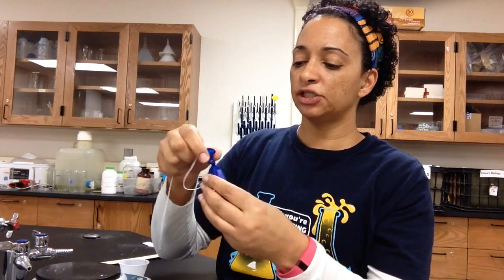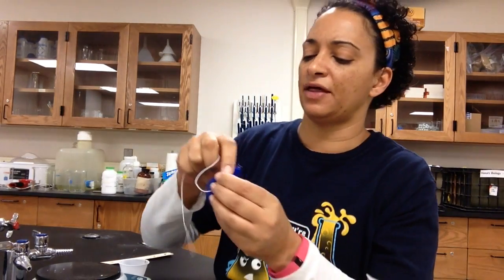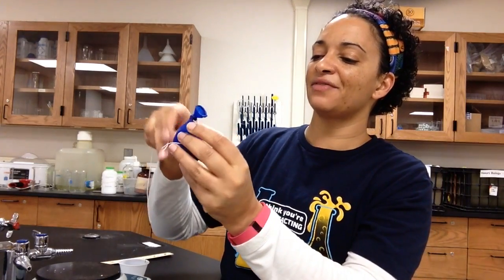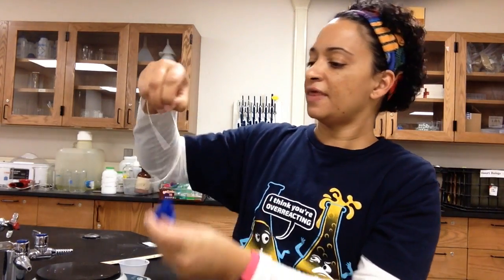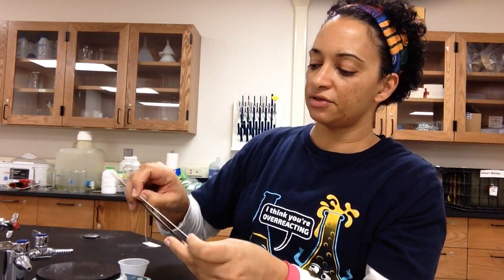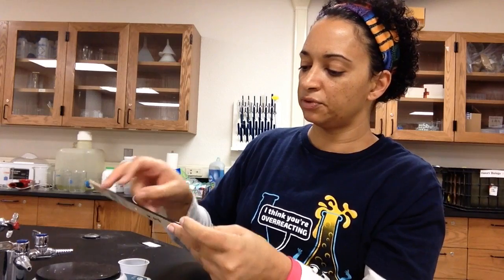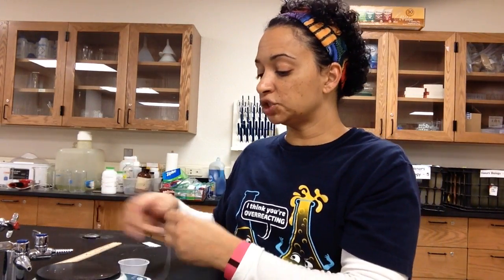Then I need to measure the circumference of the balloon. I'm going to take my string and measure around the circumference of the balloon, then use my ruler to figure out what that circumference is in centimeters. Right now the circumference of my balloon is about 10 centimeters, so I'm going to write that down as my initial circumference.